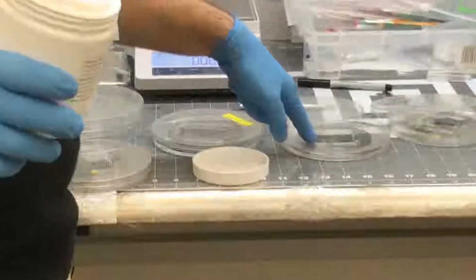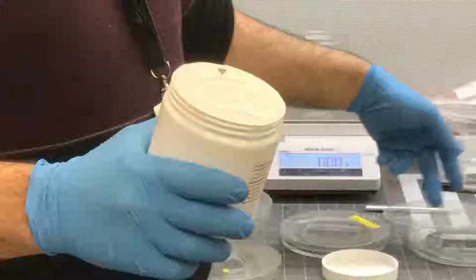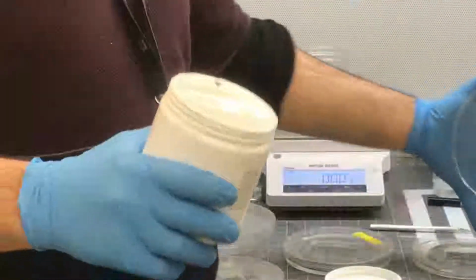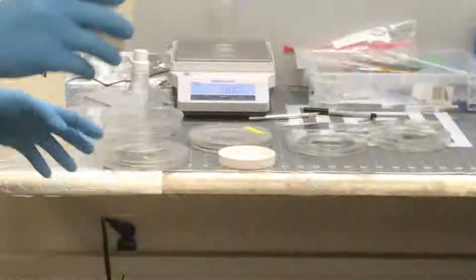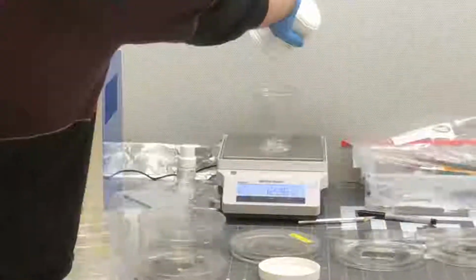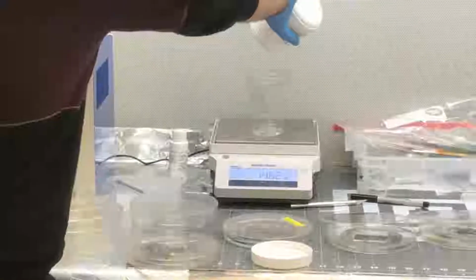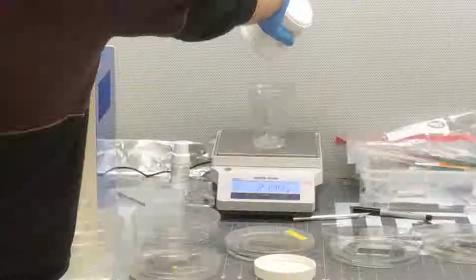Okay, I understand. So there is a calculation. You can calculate based on the area and the height of your chip. Mostly we needed 5 millimeter height. For 5 millimeter height and the area of the surface of the chip that you want to cover, you can add the PDMS. But normally we will understand based on the experiment. I have to show you something, a good-looking picture sometime. Okay, so now we add it. So you are now adding what? PDMS. When we add the PDMS, just be careful. It goes directly to the bottom of the mold.